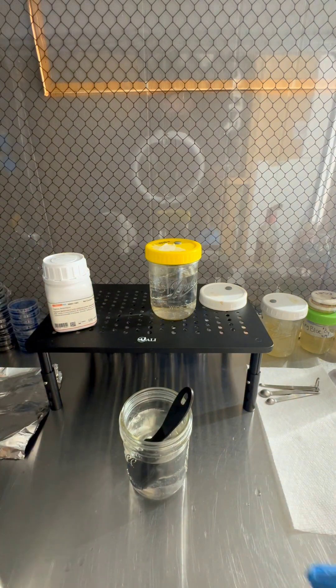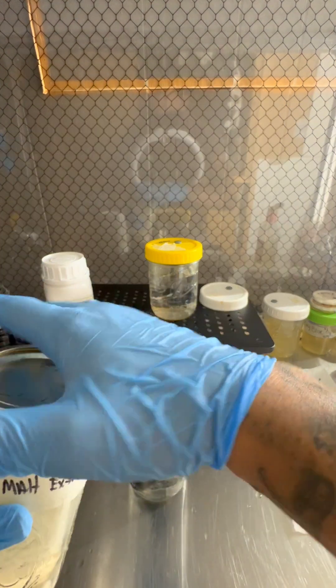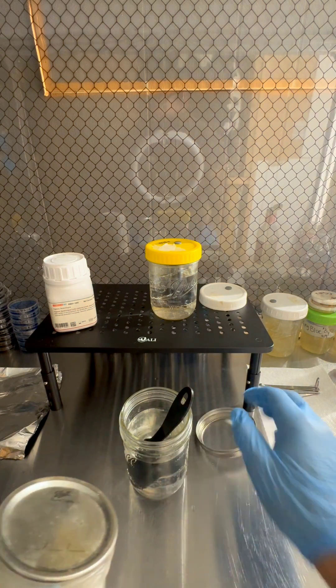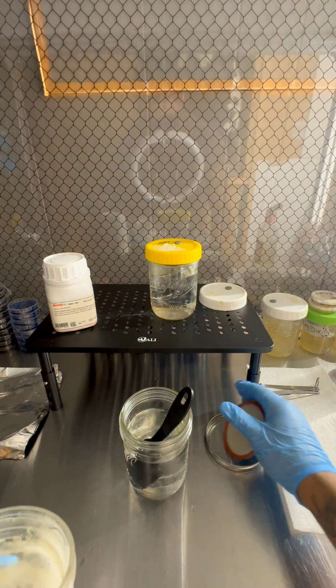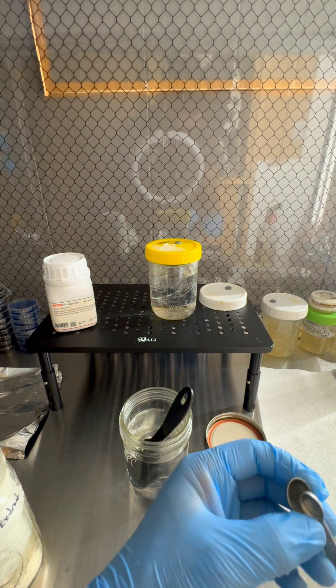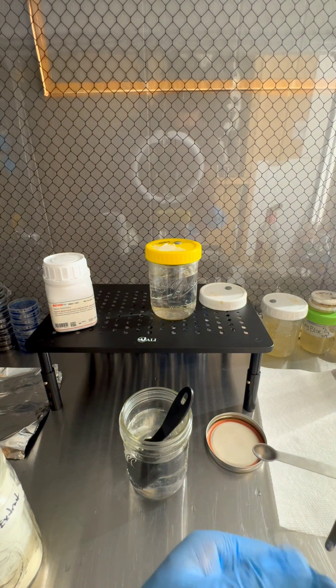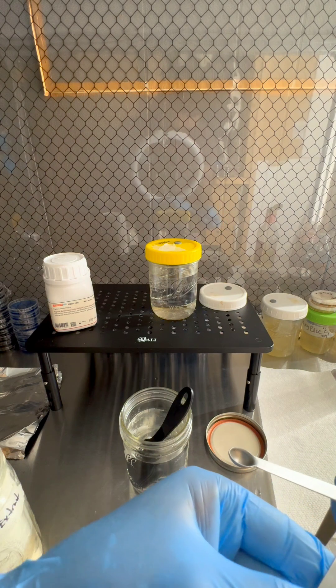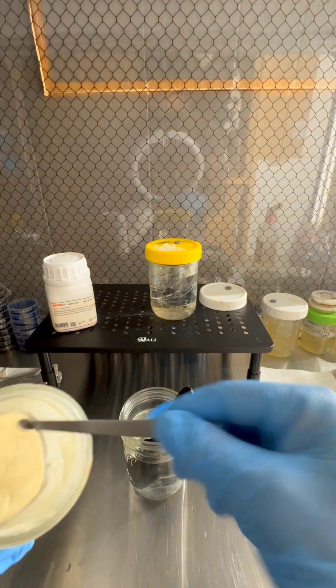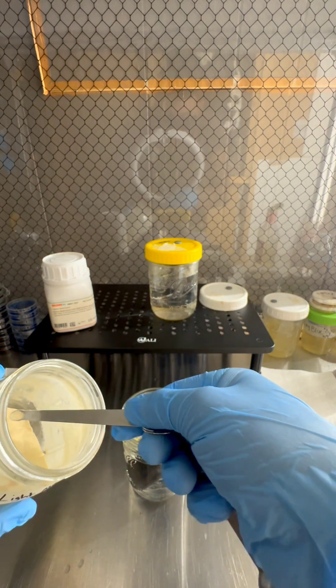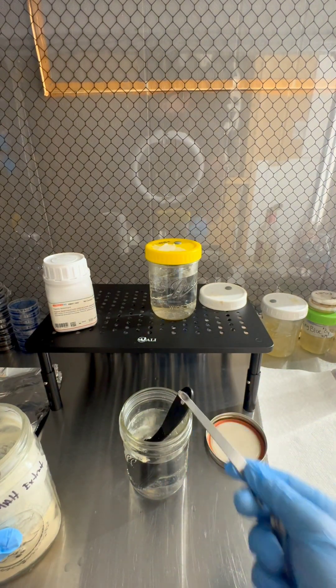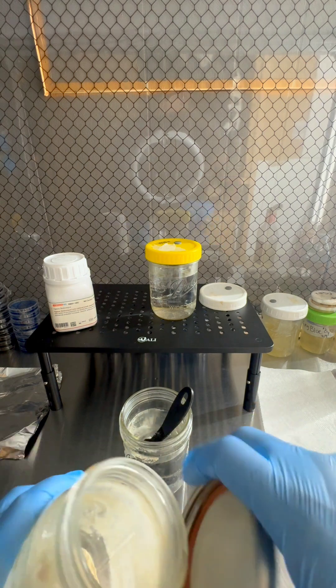But I'm going to add some light malt extract. I'm going to get the lid off. So I like to add 1/32 teaspoon of light malt, just a little bit. That much, not much at all.